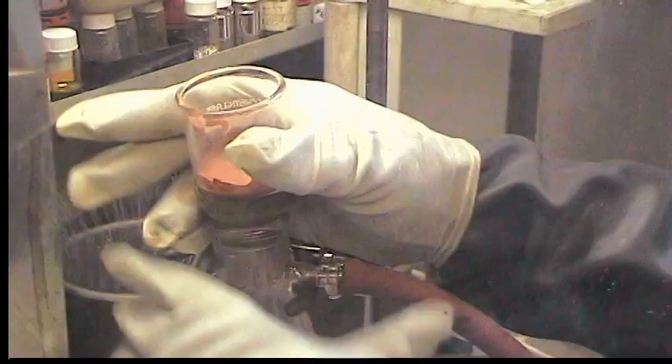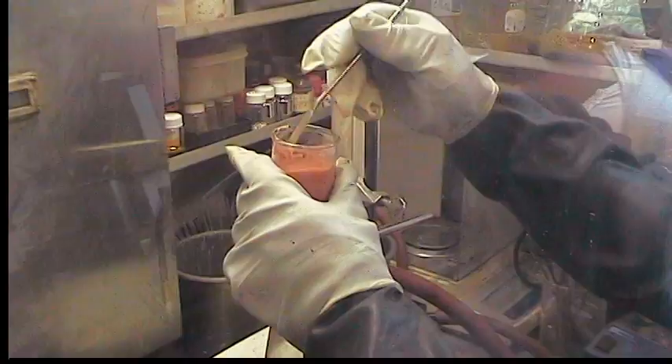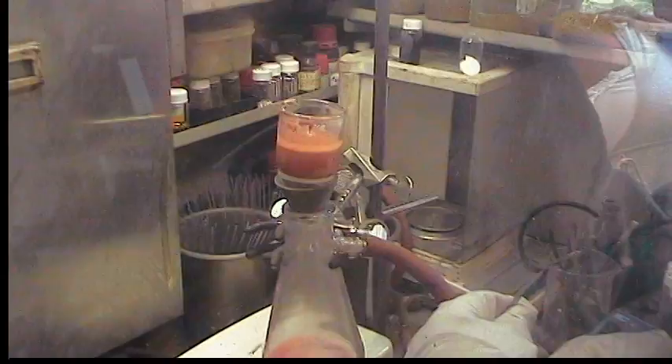Synthetic chemists are frequently busy people, so I like to wash it with diethyl ether twice, which removes the THF that's just sitting around the molecules of molybdenum trichloride THF. Instead of pumping THF off the powder, we'll be pumping off diethyl ether, which is quite a bit quicker.